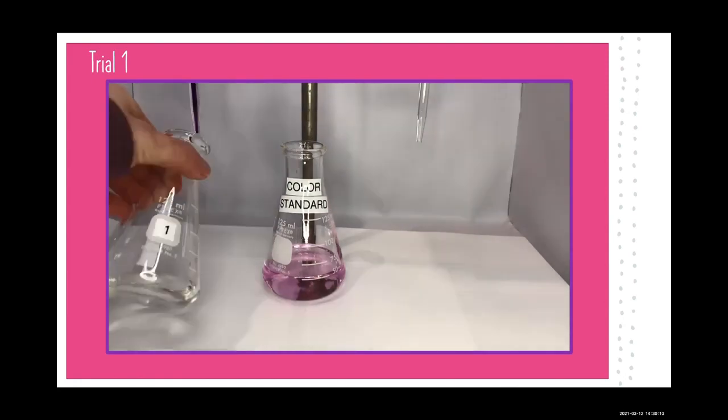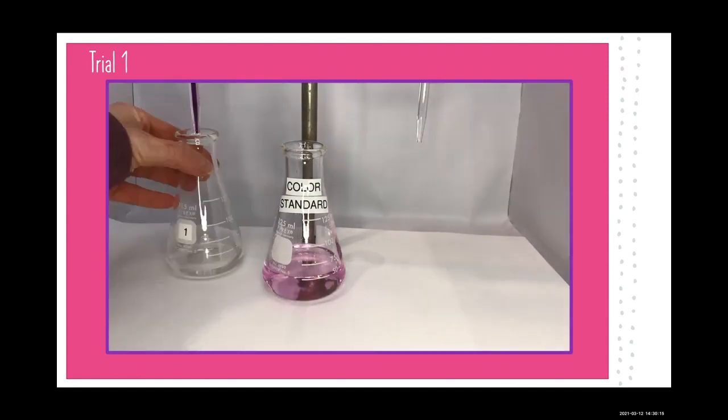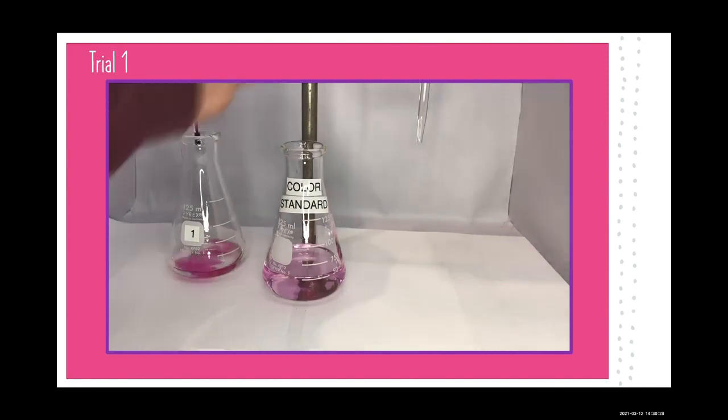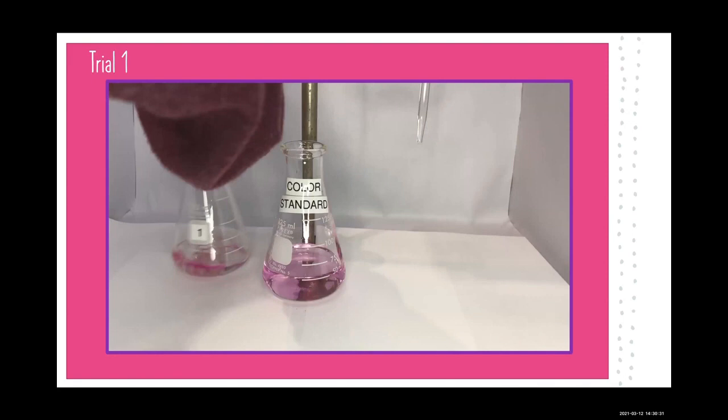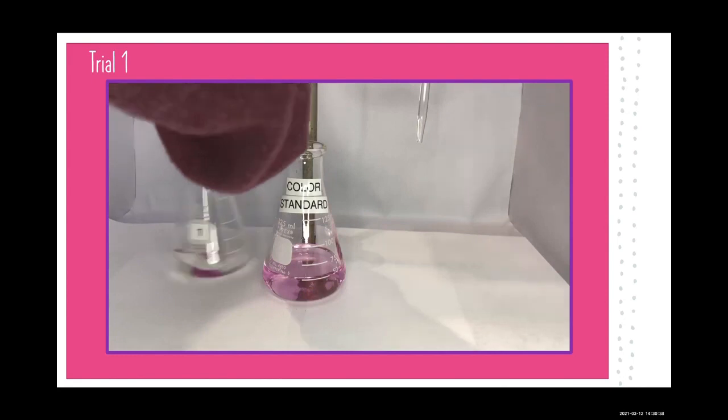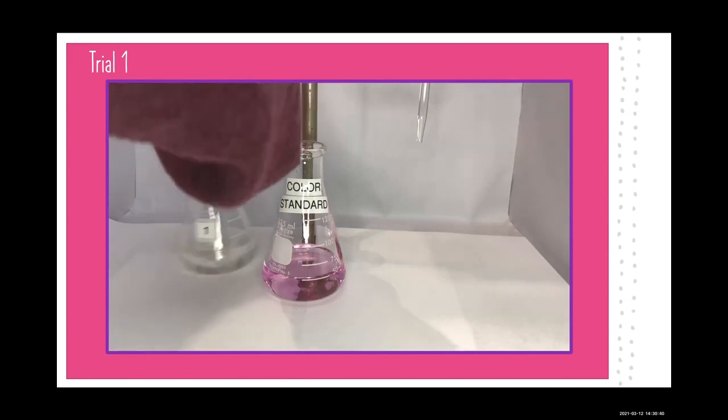So as I said before, I like to titrate by swirling with my left hand and using my right hand to control the stopcock, but I kept getting my arm in front of the camera. I had a hard time finding just the right drop rate. You also want to be careful not to get any drops on the side, and I did because I'm leaning in at a weird angle.